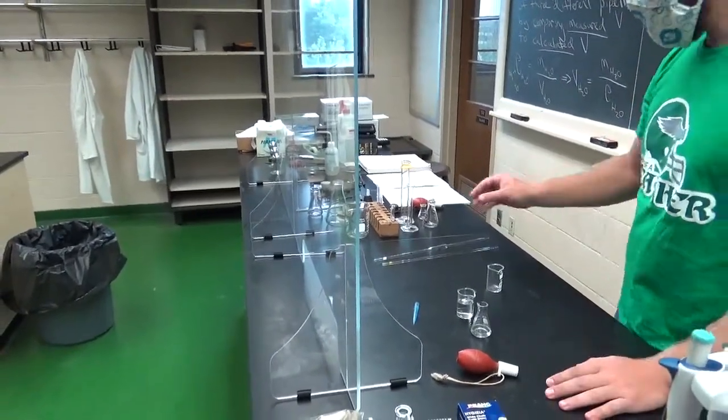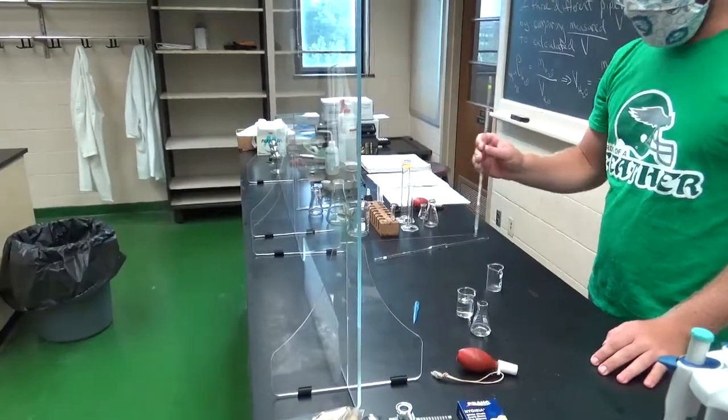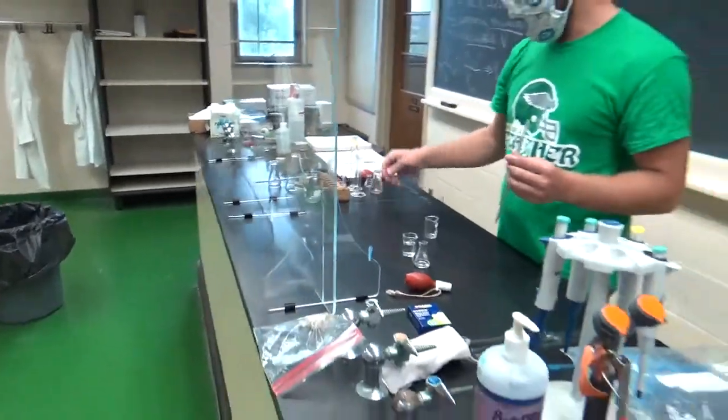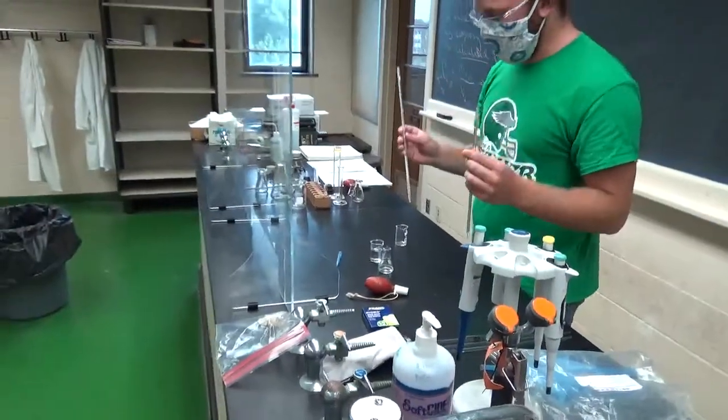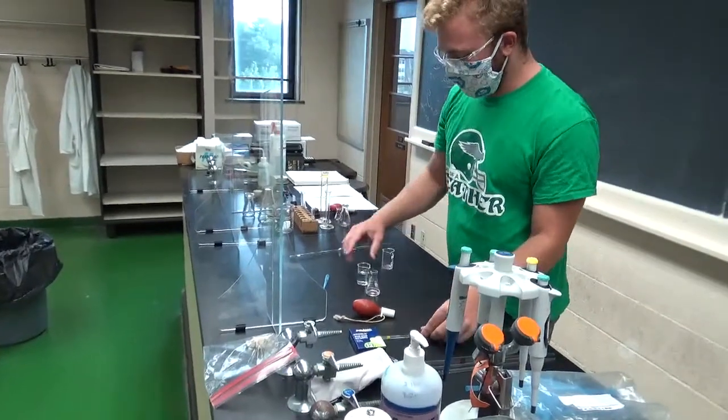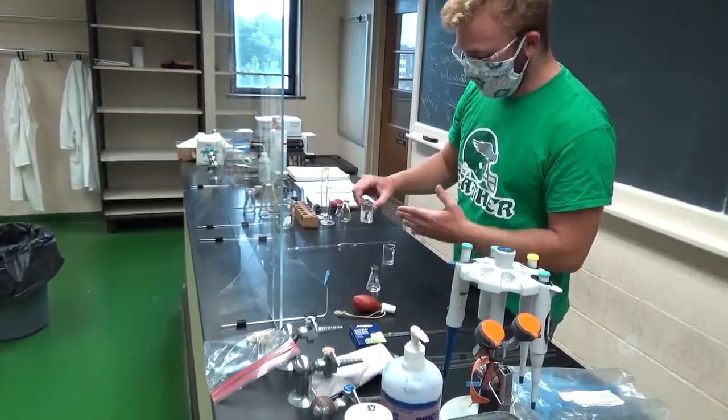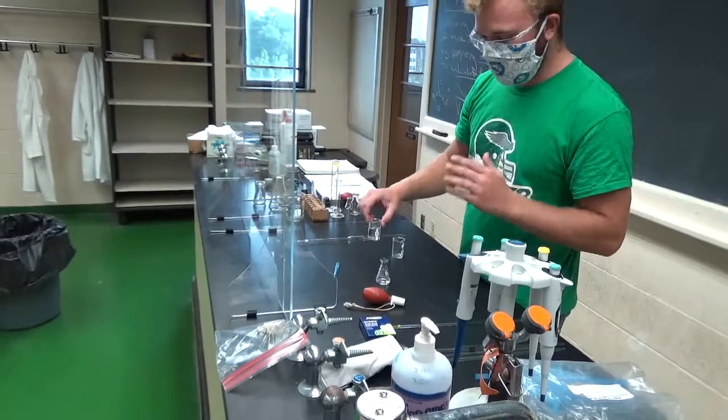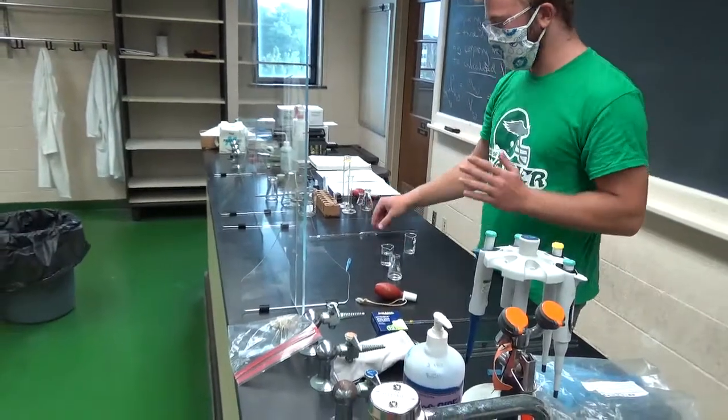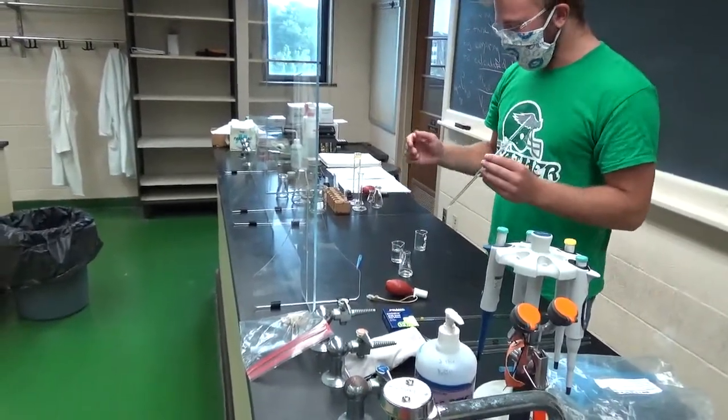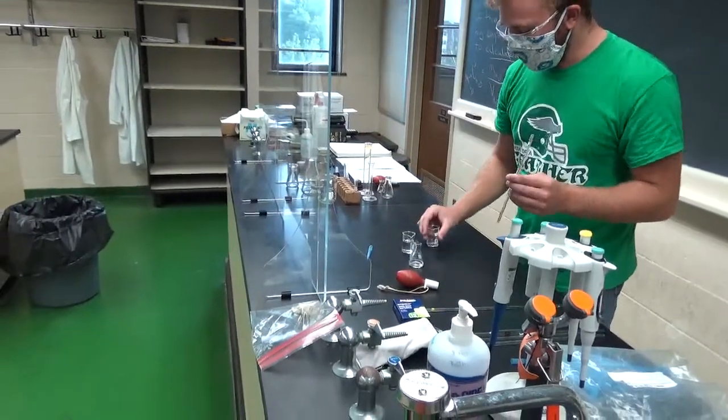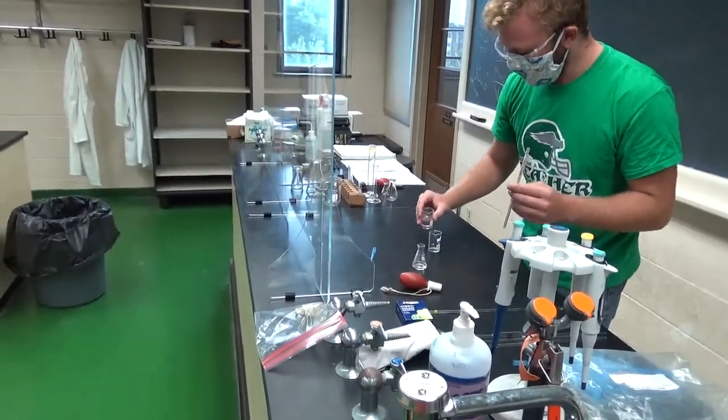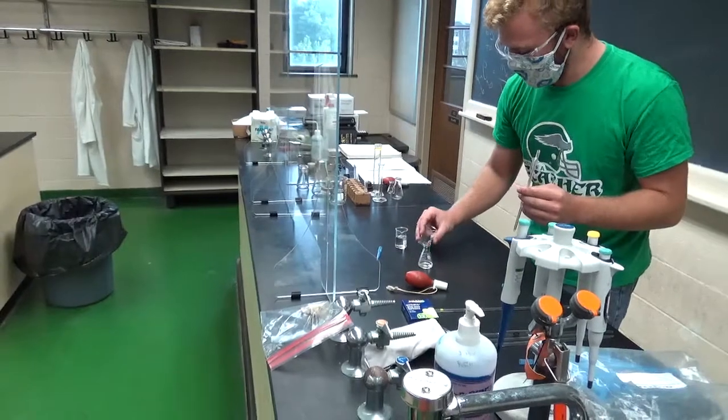When you do pipette up solution in either of these pipettes, you always want to make sure that you have more of the solution than what the pipette actually takes in. Because if you don't have, say there's only a little bit, here I'll do a little demo of it.